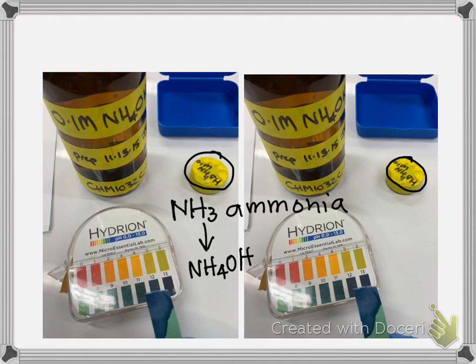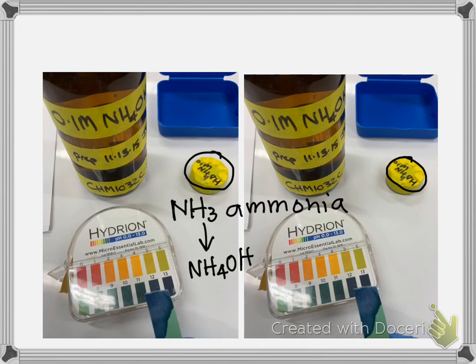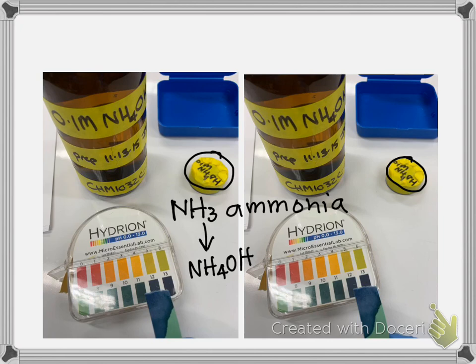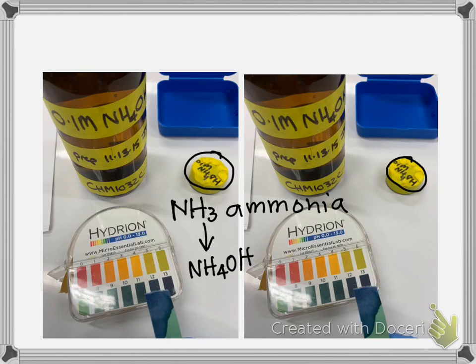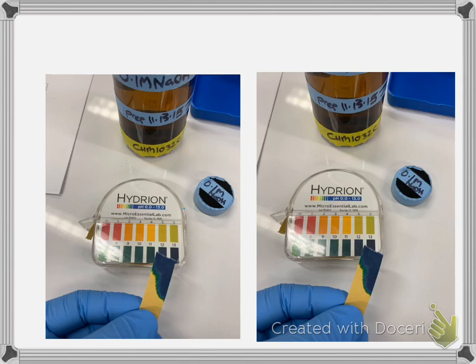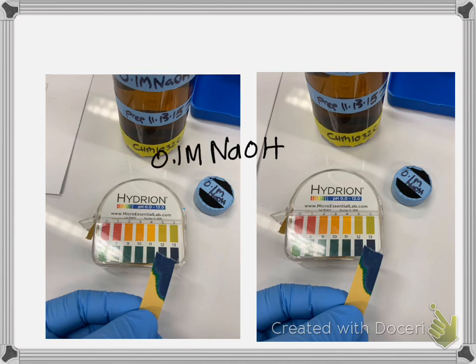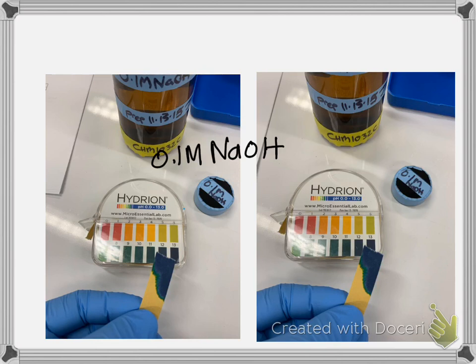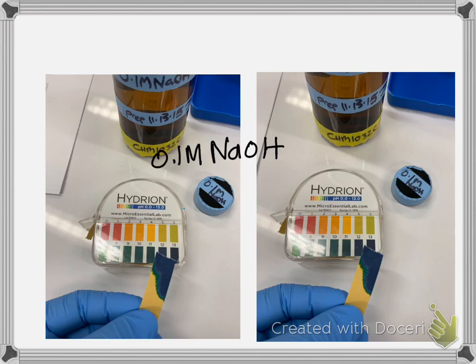These are two pictures of the same ammonia sample. I just moved it between the two color ranges. Remember, you can use a 0.5 if you think it's in between. Because we're using our eyes as detectors, sometimes there is a discussion about color differences, so don't be too worried. Then these are also two pictures of the same thing — sodium hydroxide. The reason there are two pictures is so you can see the differences by holding it next to both colors.